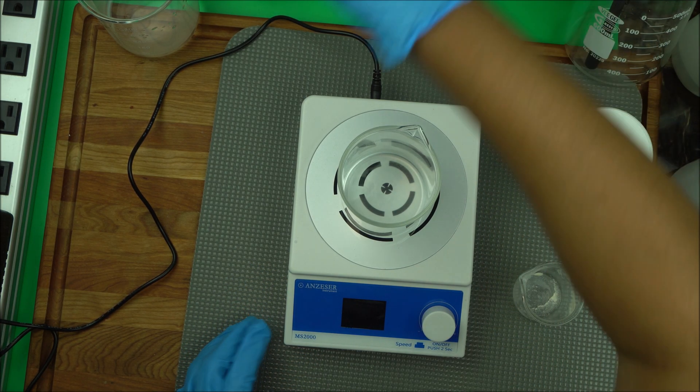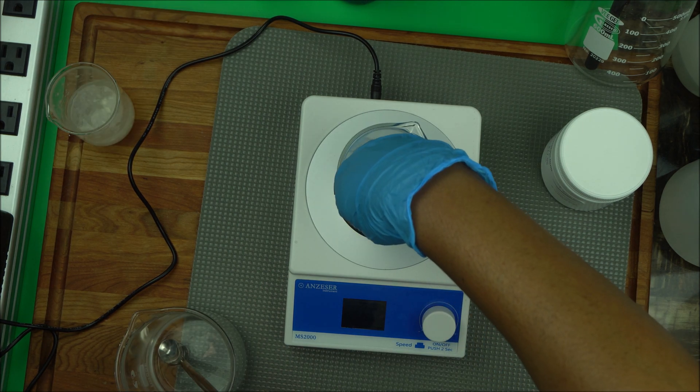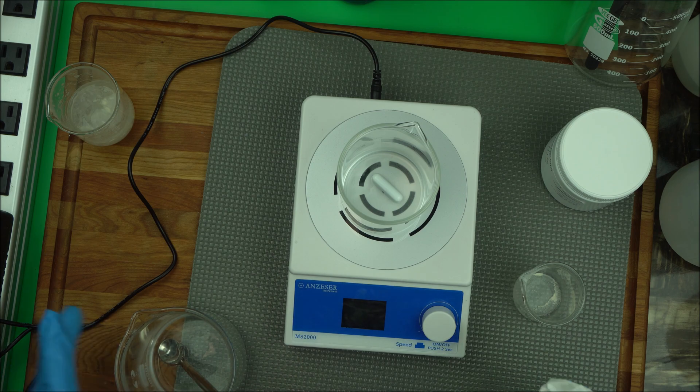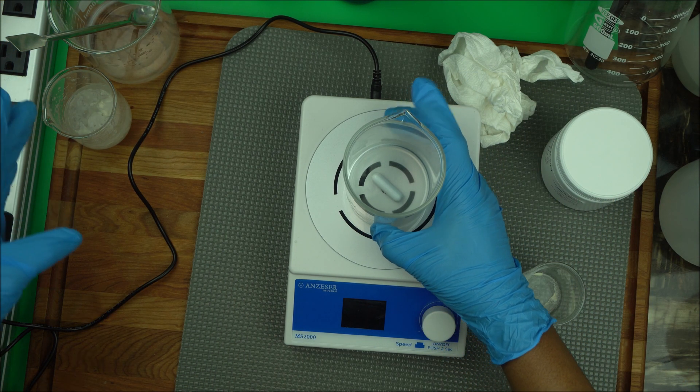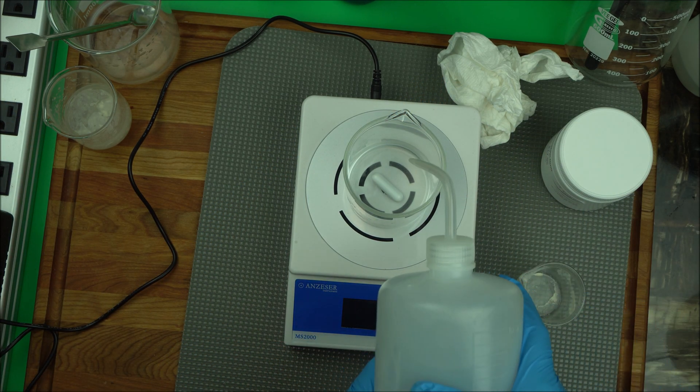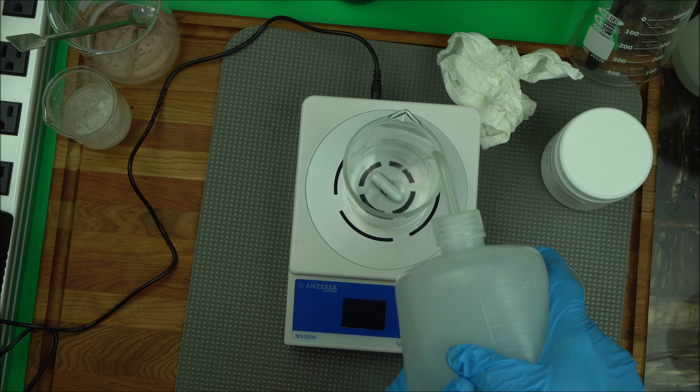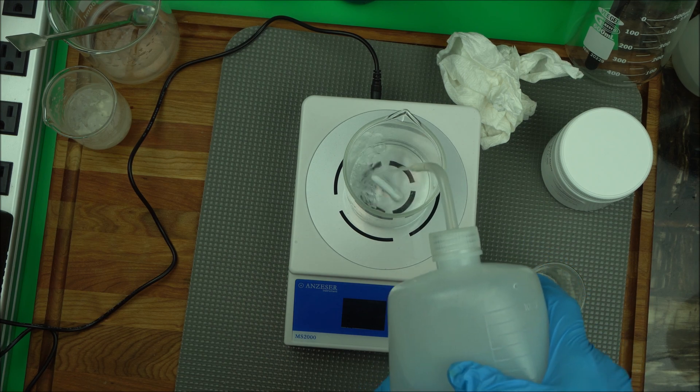Then we are going to get the stir bar inside the beaker. Be careful though because of the strong magnetic force, it can break your beaker. Then you add your water. Measure the amount of water you want to make.